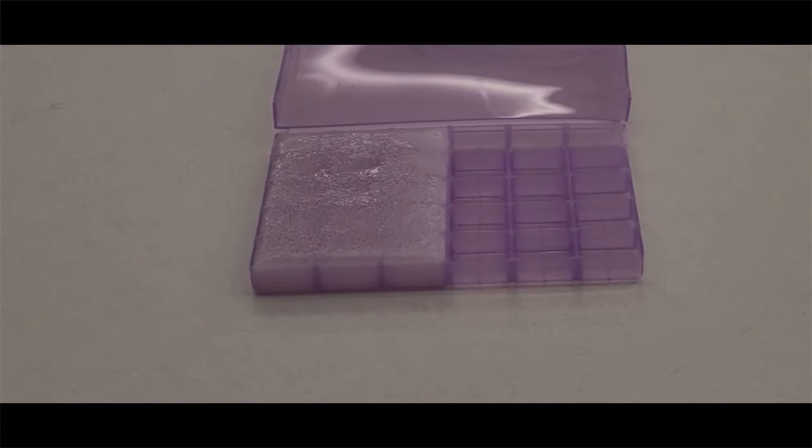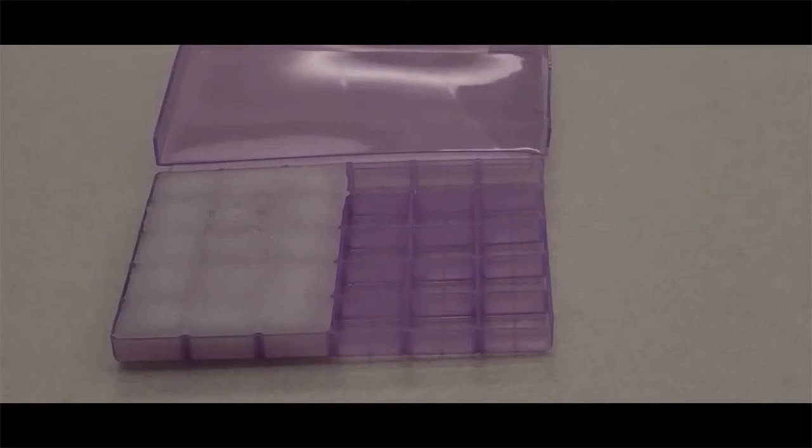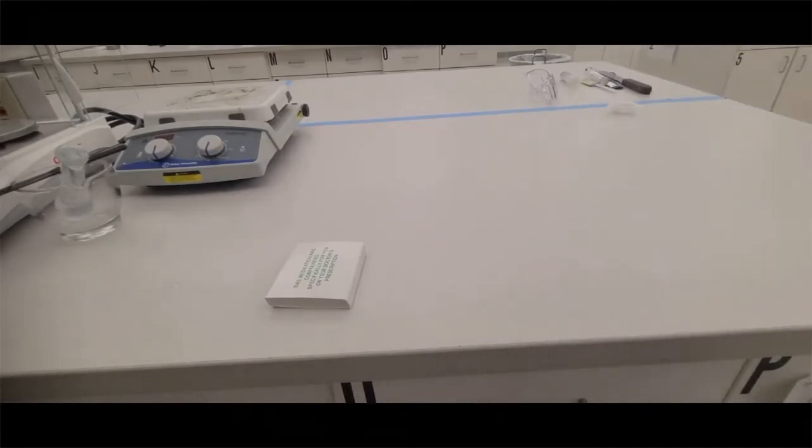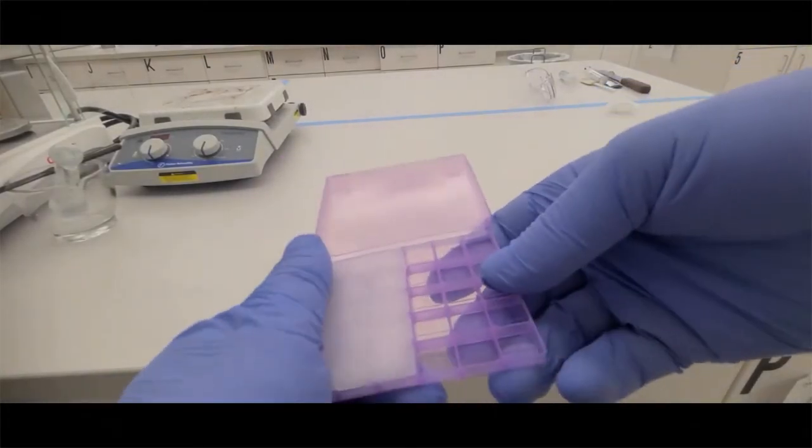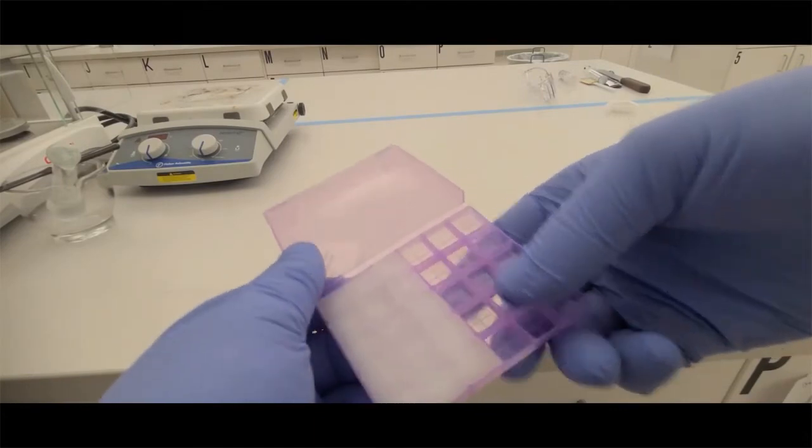They'll also turn white and the front top side will be a little bit rough. So some people like to take a heat gun and usually try to polish them off. Other times people will pop them out and turn them over.